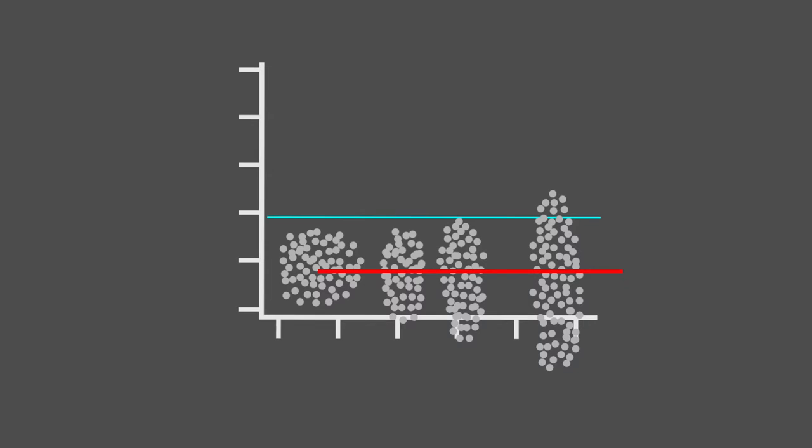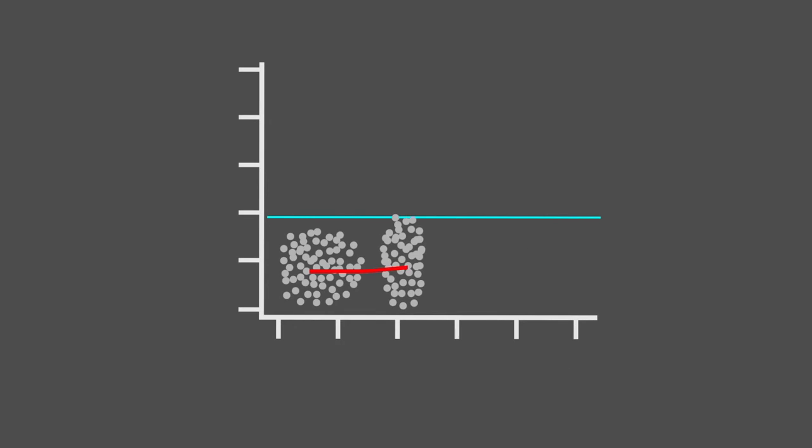When doing a manual calibration, we can use markers of different fluorescence intensity. Choosing the right marker is crucial for the calibration. If the marker has too weak an emission, the positive population will be too close to the negative one, thus making small compensation difficult to see.